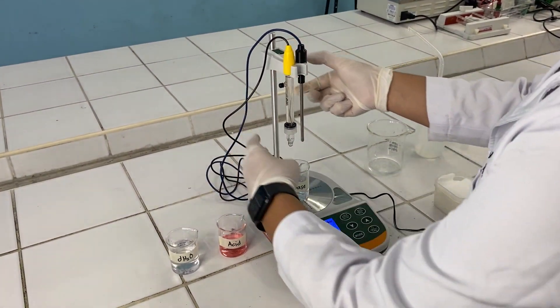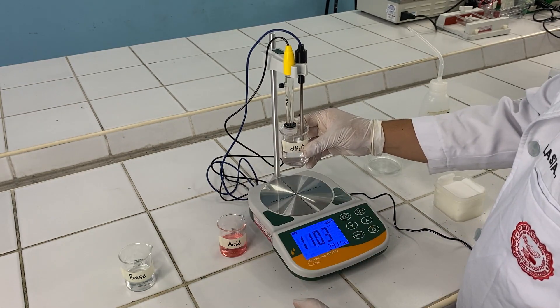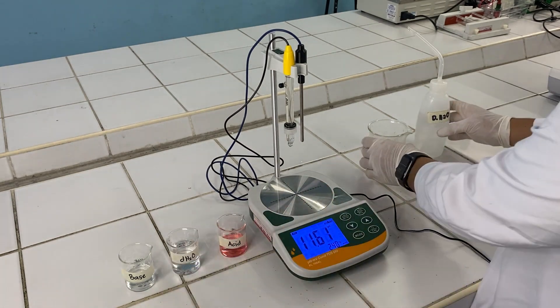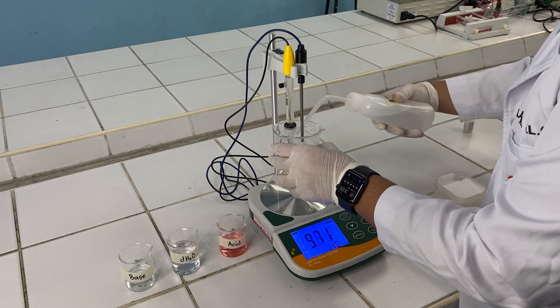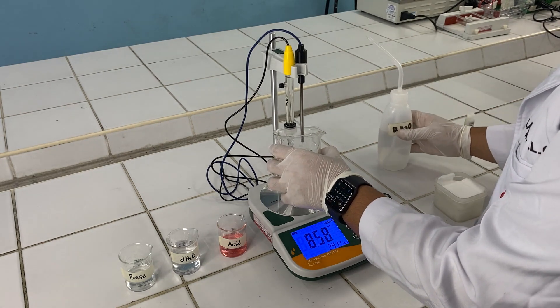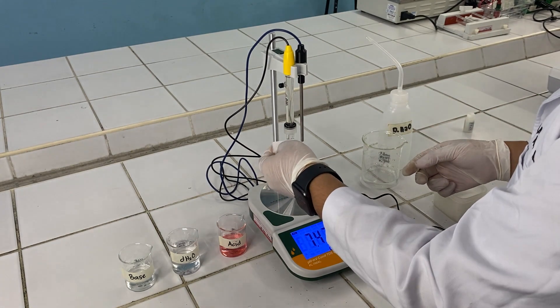Then, ascend back the electrode for you to be able to wash it. Submerge it first in distilled water for a couple of seconds. Then, rinse it well with another distilled water to completely wash off any residual solution. Then, carefully wipe off the electrode, including the temperature rod.